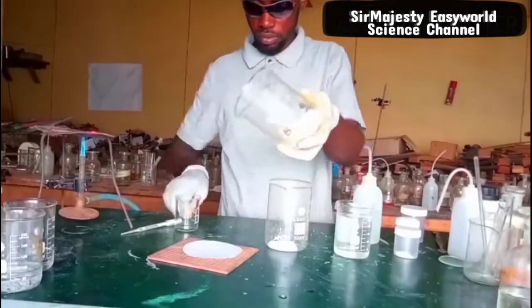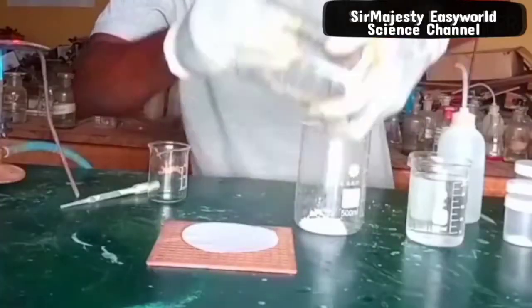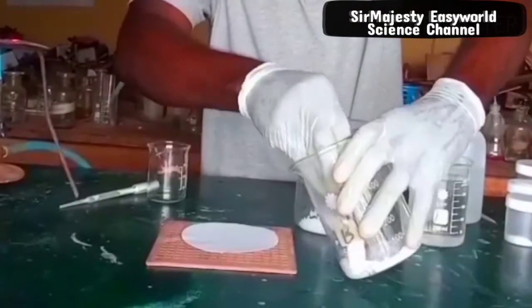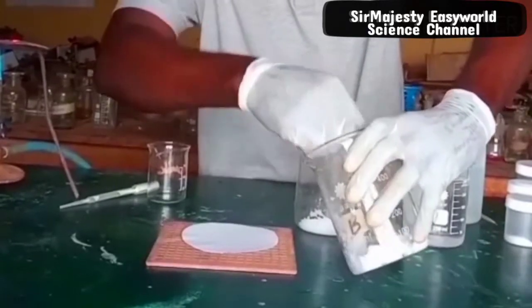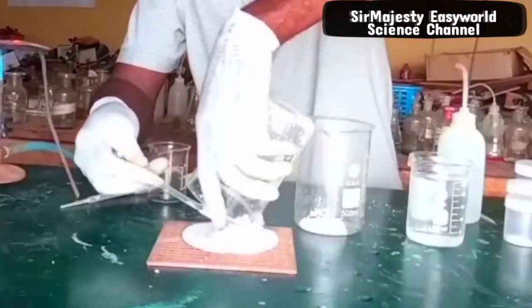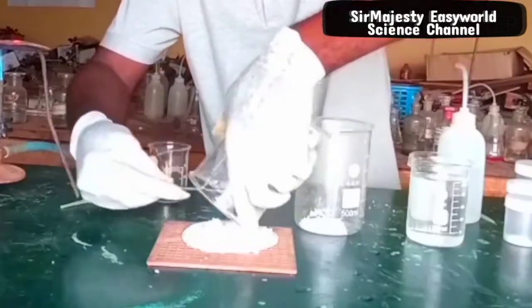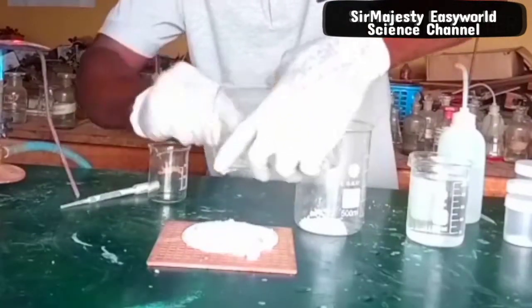When you scrape it out, spread it well on a tile or between filter papers to get it dried up very well. You can see the crystals are very nice.